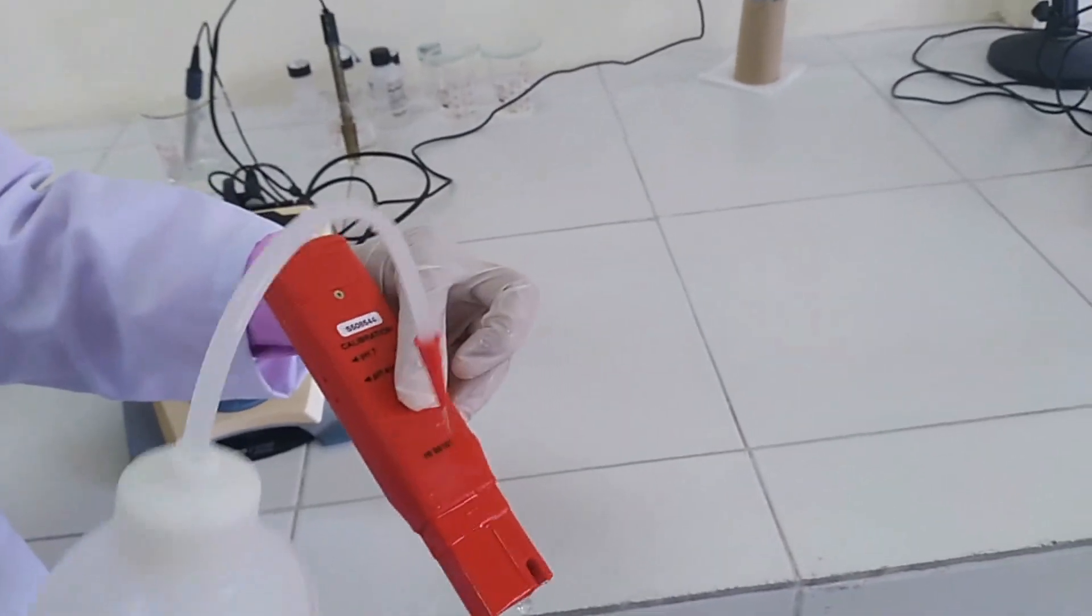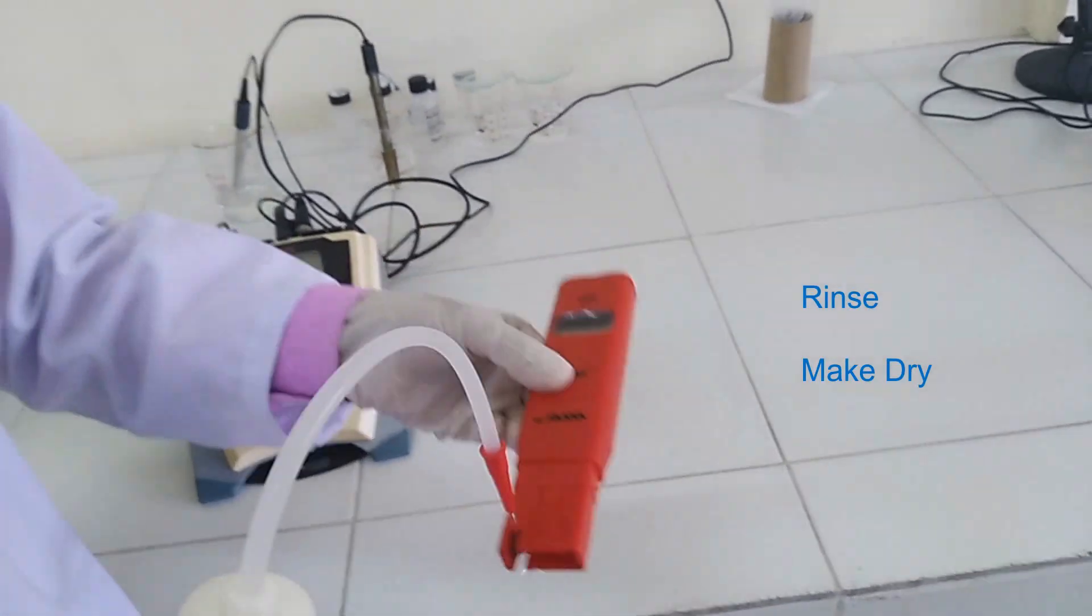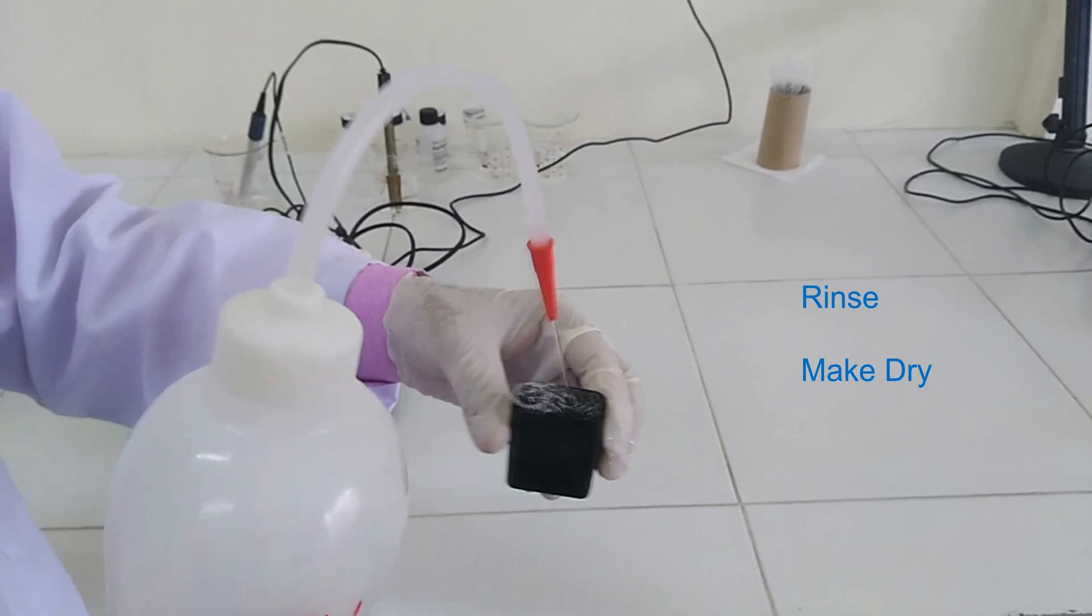For this, again clean the pH meter and cap by deionized water and make it dry.